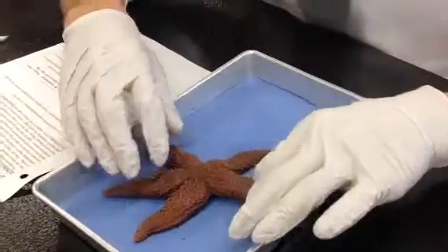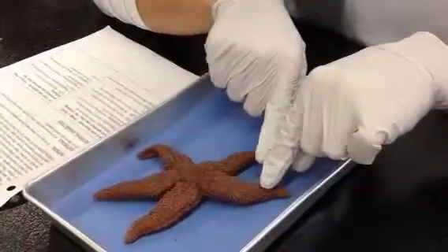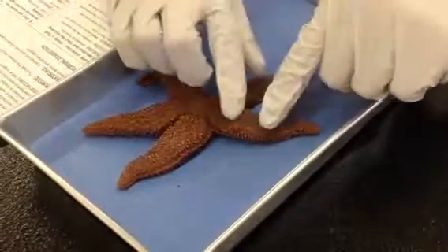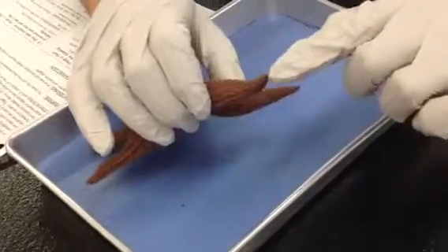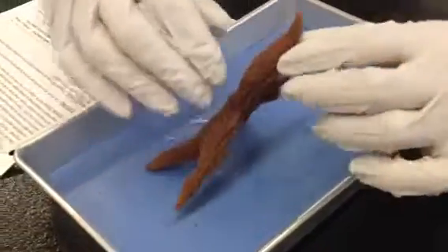The spines — many of them are short and rough, these little things. And eye spots are located on every end of each arm.